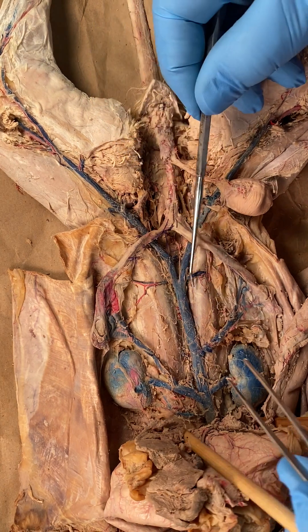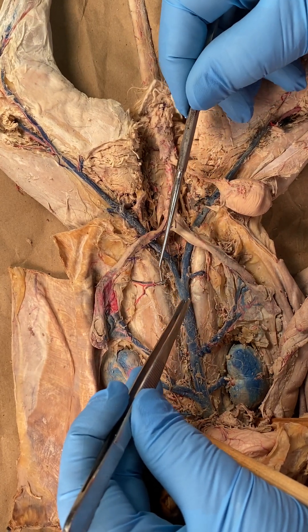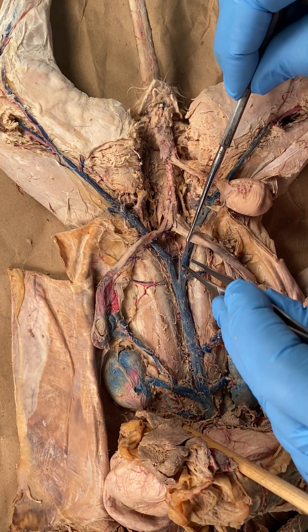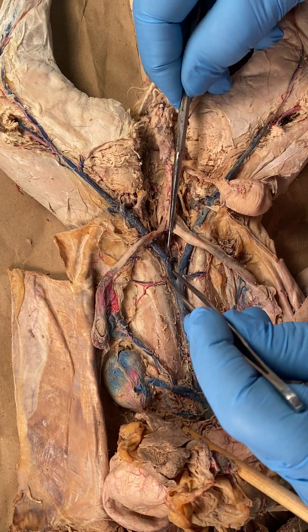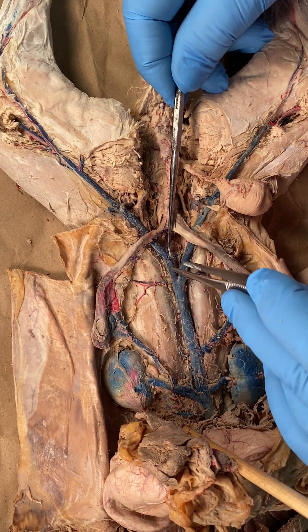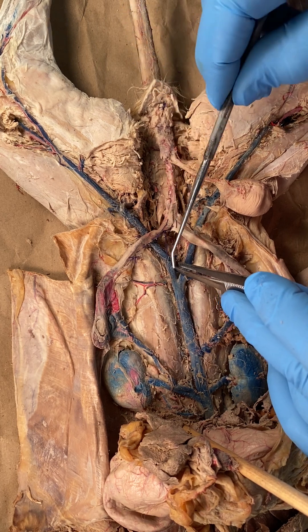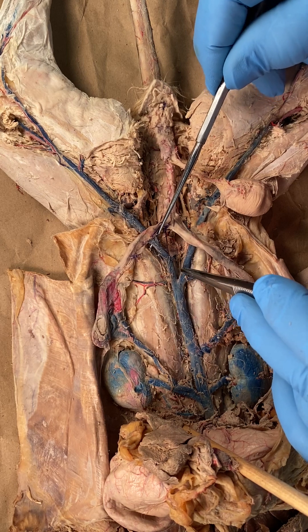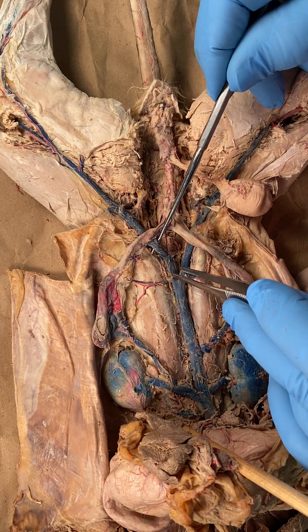Down here, the ilial lumbars are next — left ilial lumbar, that one's broken but you can see where it was. Then you've got the common iliacs: here's the right common iliac, left common iliac. There's the broken internal iliac, which defines what the common iliac changes its name to — the external iliac. So: left common iliac, left internal iliac, and now this is the left external iliac.